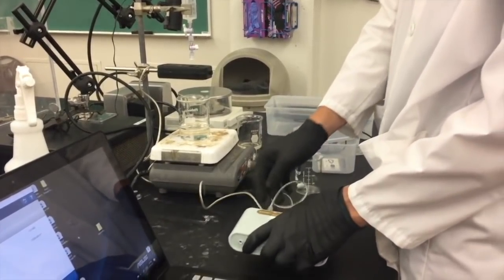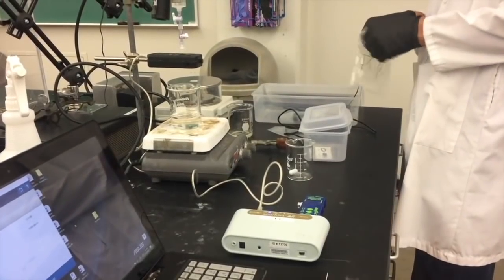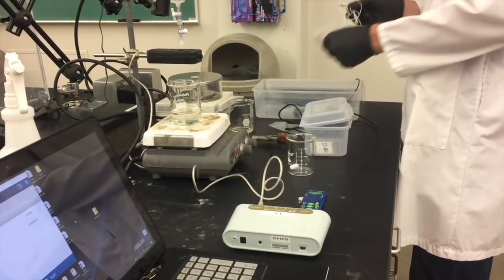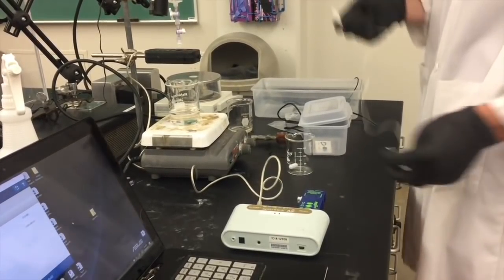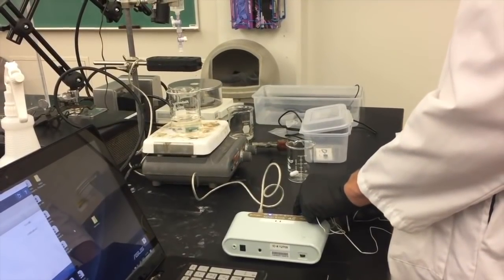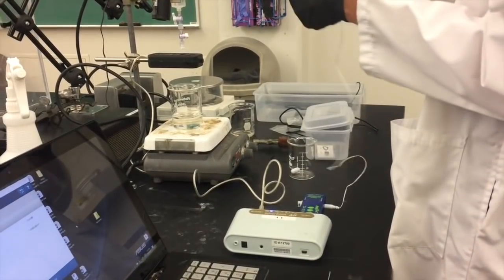Now you'll need to plug the quick response temperature sensor, it's the one that looks sort of like a white shoelace, into the side of the advanced chemistry sensor. Don't place it directly into the SparkLink Air unit as you have done in earlier experiments.